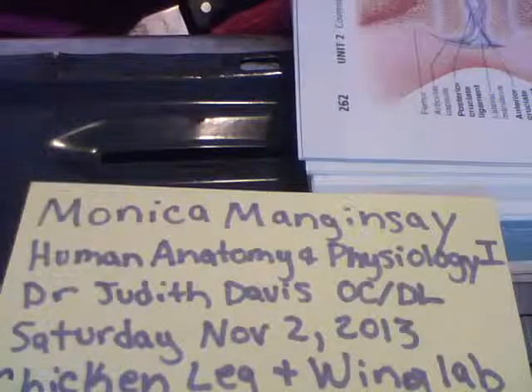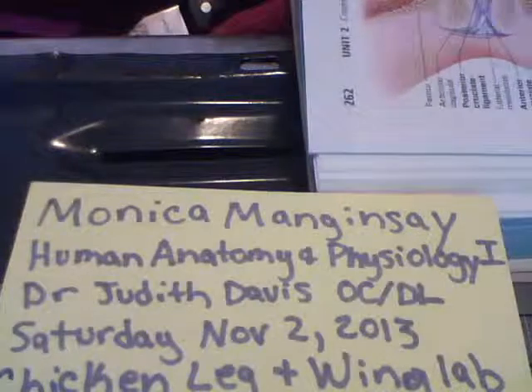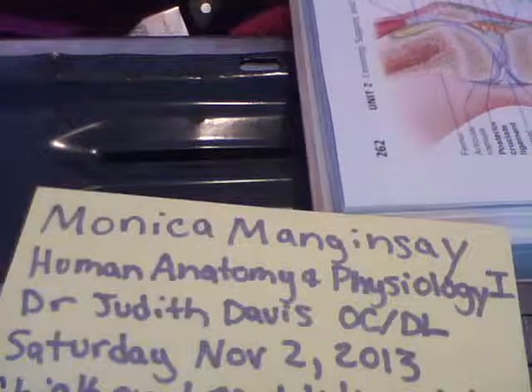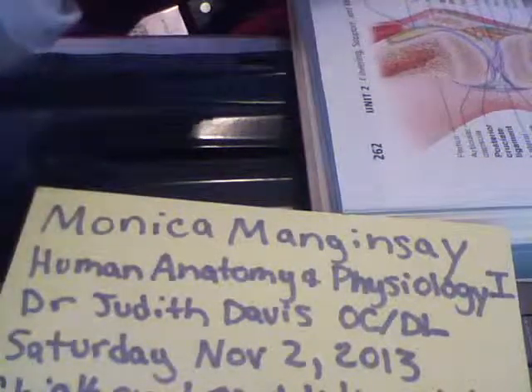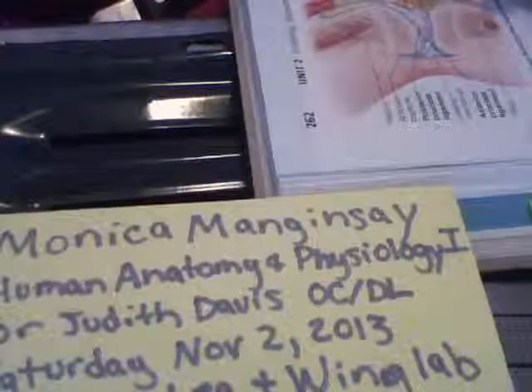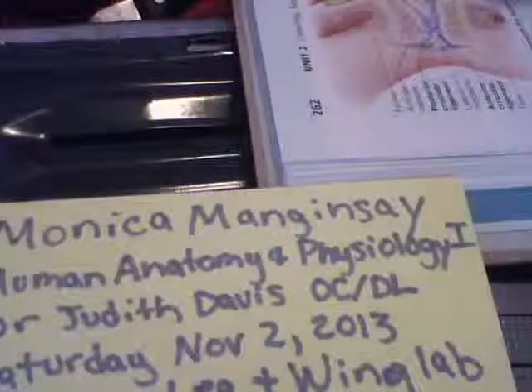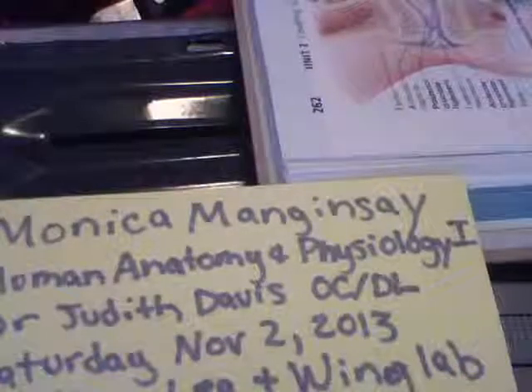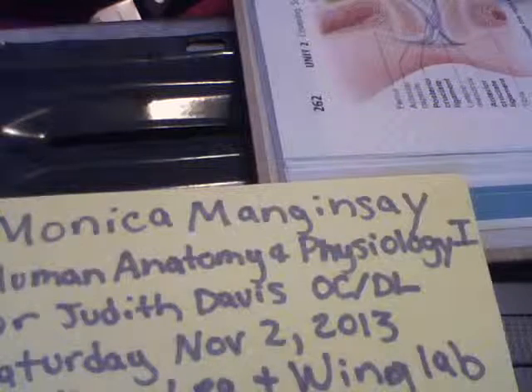The knee joint. The knee joint is the largest and most complex joint in the body. Despite its single joint cavity, the knee consists of 3 joints in one, an intermediate one between the patella and the lower end of the femur, the femoropatellar joint.